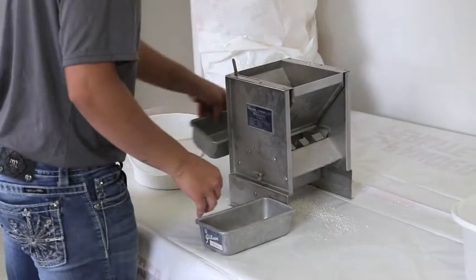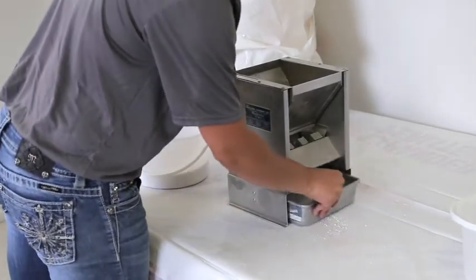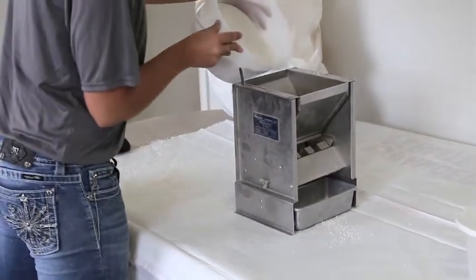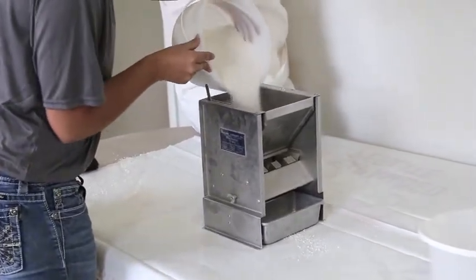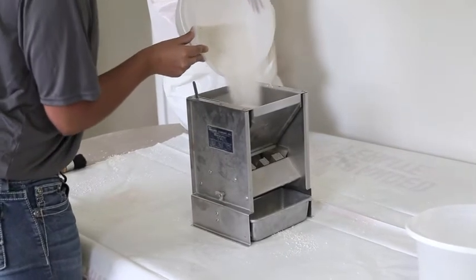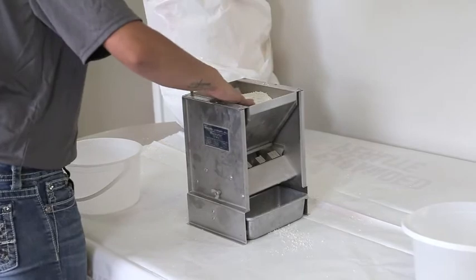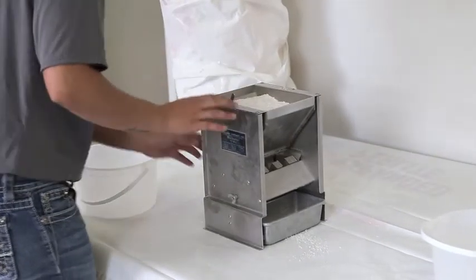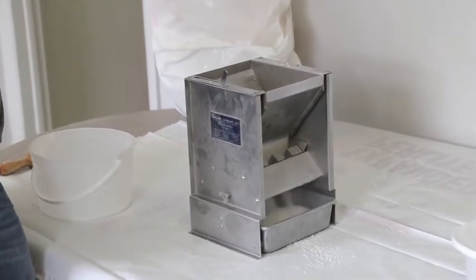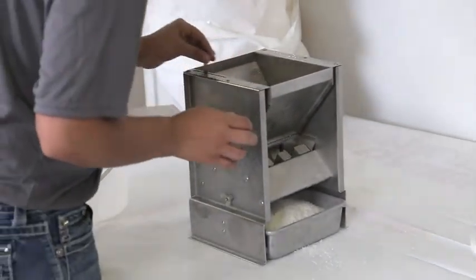The following procedures are from ASTM C702. Place the original sample in the hopper or pan and uniformly distribute it from edge to edge so that when it is introduced into the chutes, approximately equal amounts will flow through each chute. Introduce the sample at a rate so as to allow it to flow freely through the chutes and into the receptacles below.